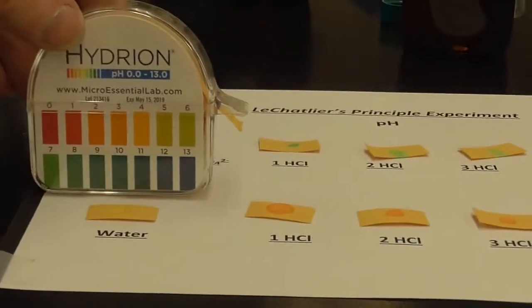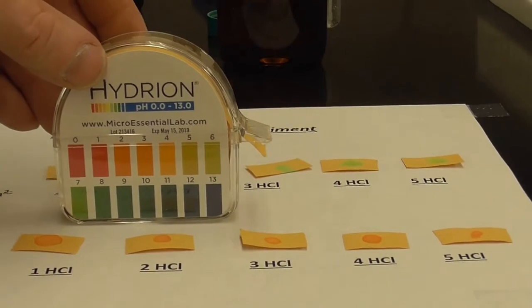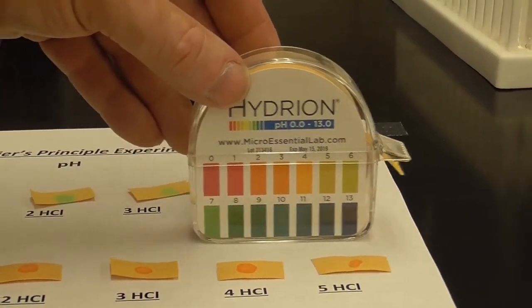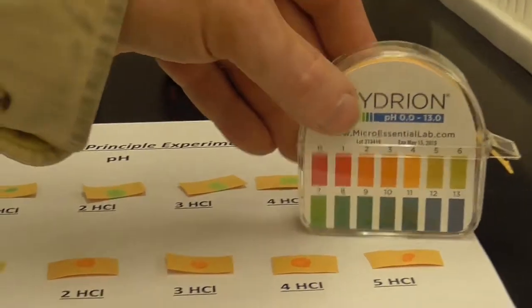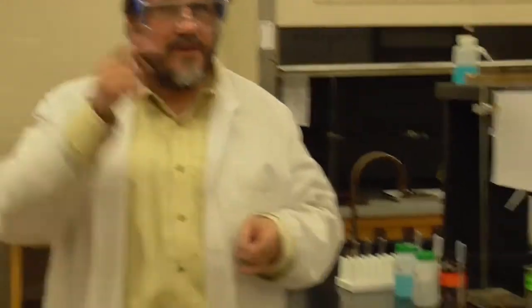And the water. Of course, the colors don't match perfectly. You get as close as you can when evaluating this. Okay? That is, without giving away exactly what's happened, that is Le Chatelier. So as you think about how to analyze those results, remember we're talking about Le Chatelier shifts.